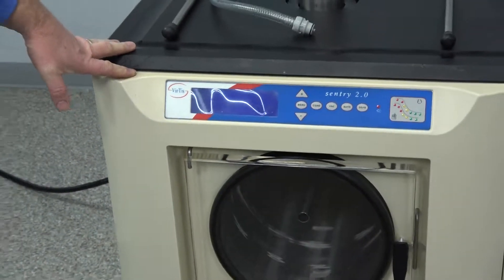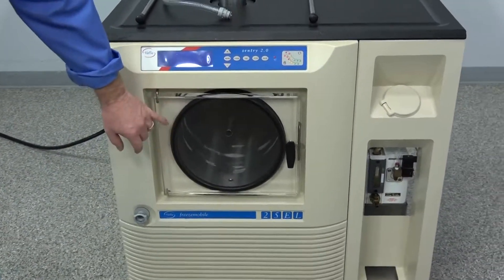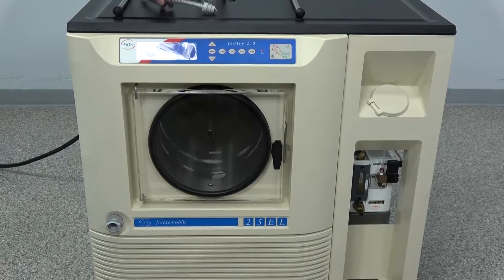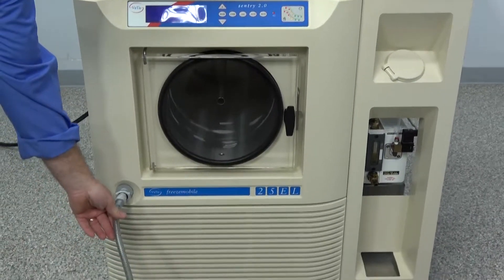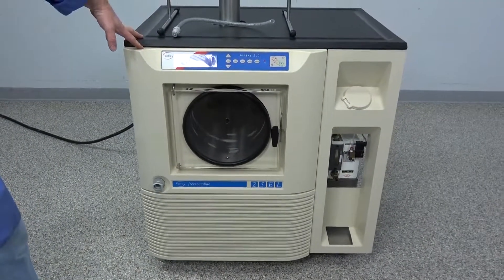We've thoroughly went through it. I did replace the front access door to the chamber here. You can see it's a nice new looking one. Of course, we got the quick release drain there where you can drain the chamber when you're defrosting it.